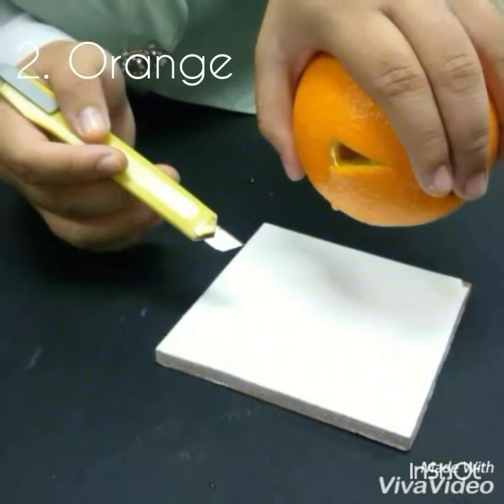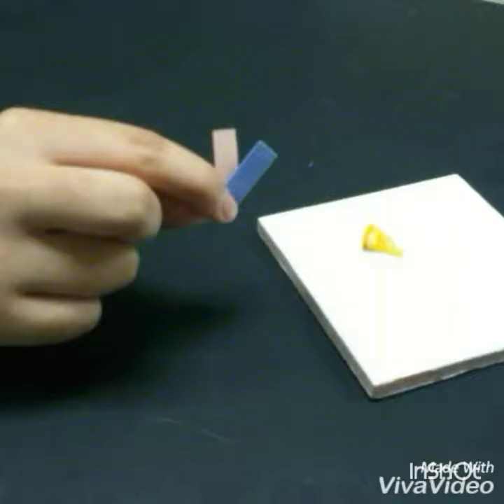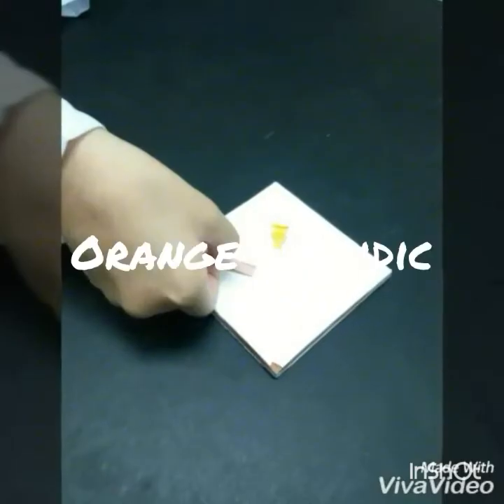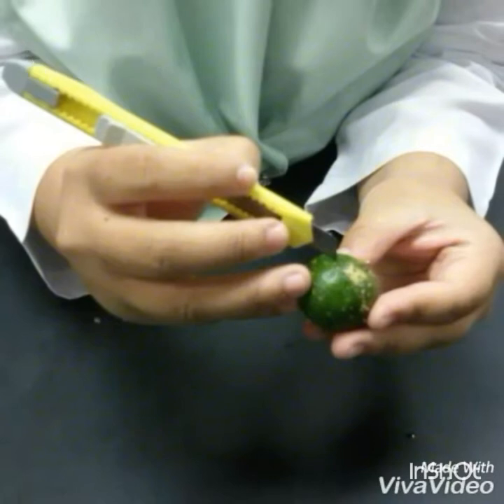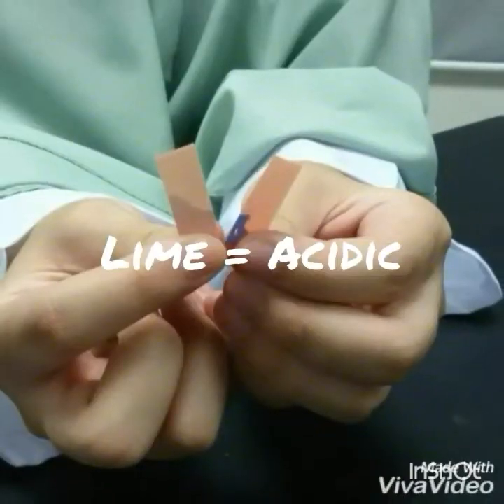Second, we test the orange juice by following the same procedure as the lemon. And also the result was the same as the lemon, which makes the orange juice also acidic. Next we test the lime. Following the same procedure as the lemon and the orange, also the result was the same. So lime is also acidic.